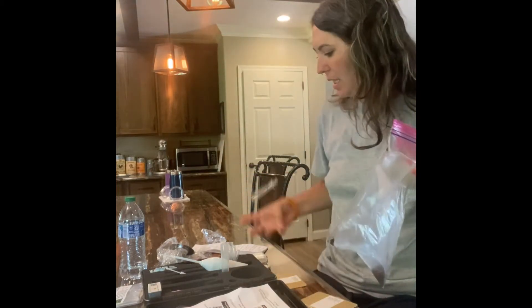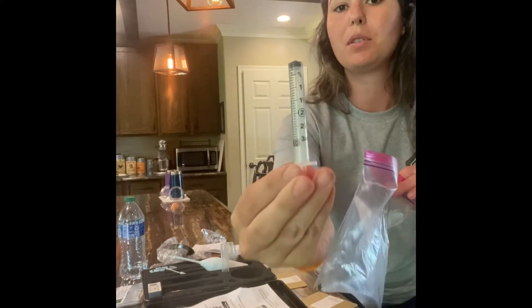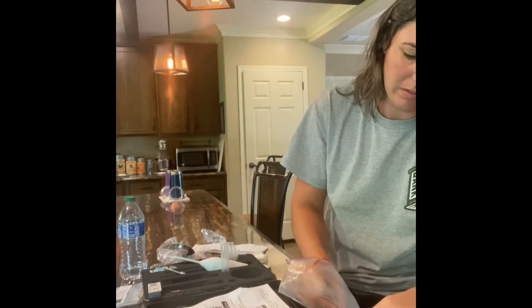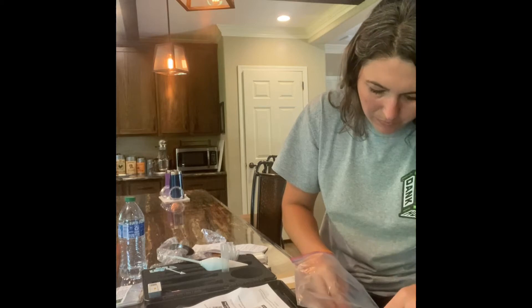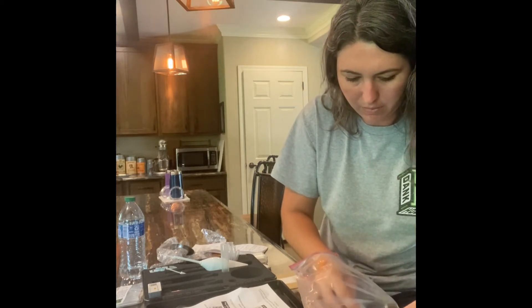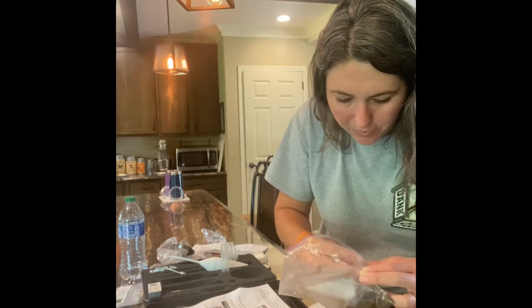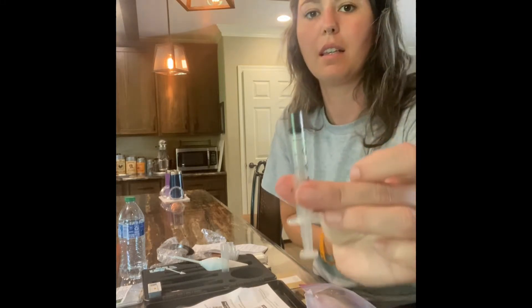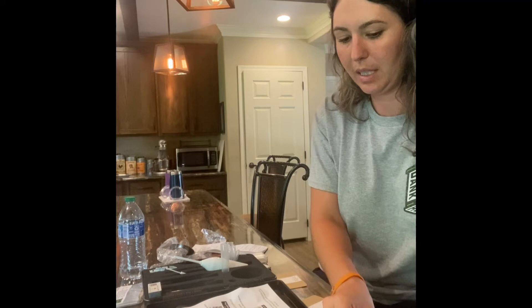We've got our soil sample. Now we're going to use this syringe. The instructions say to fill it up to the one milliliter line, so go ahead and scoop it in there. Then it says compact to half a milliliter — just put your finger over the edge and push until it gets to 0.5 milliliters. So we've got our soil sample in the syringe.